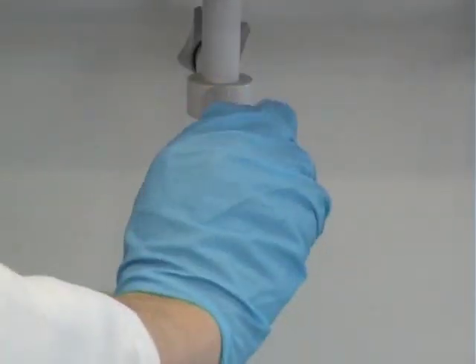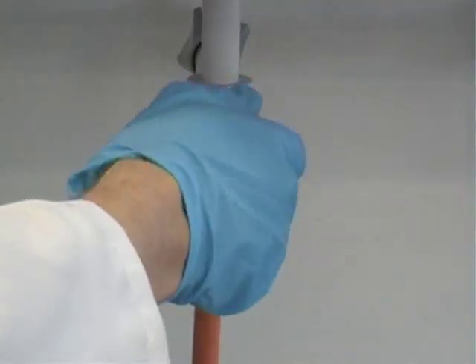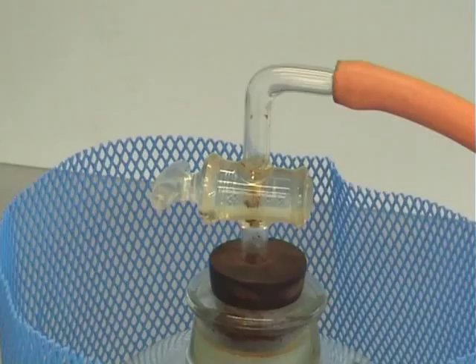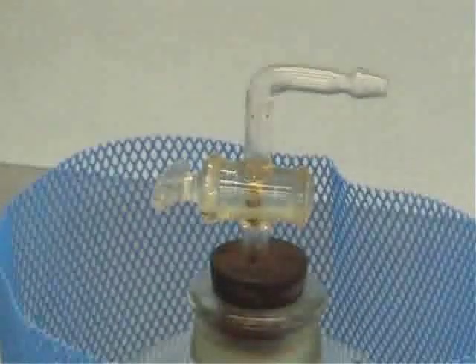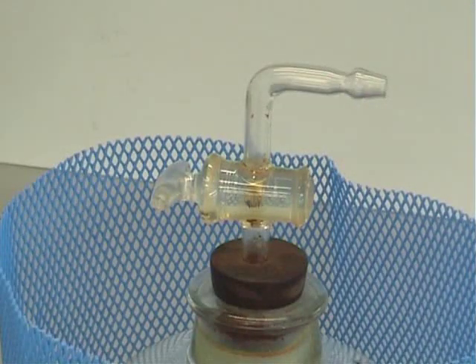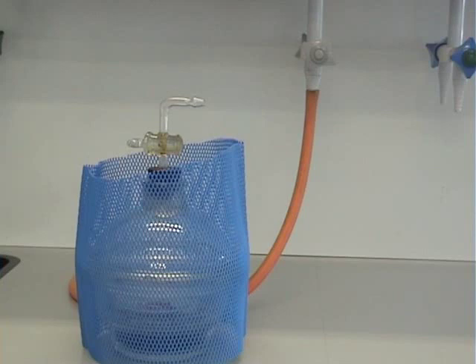Turn off the vacuum at the vacuum tap, and then remove the piping from the top of the desiccator. You can then leave the desiccator like this with the vacuum inside to dry your compound for as long as you need.